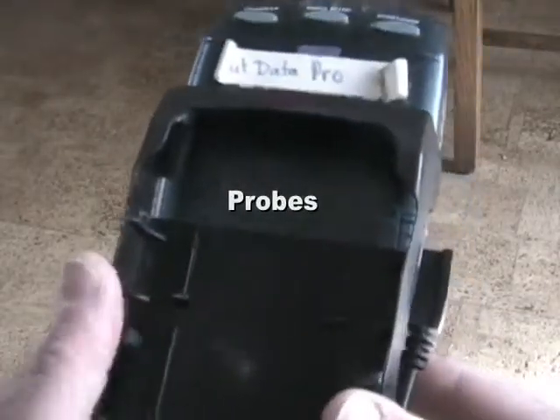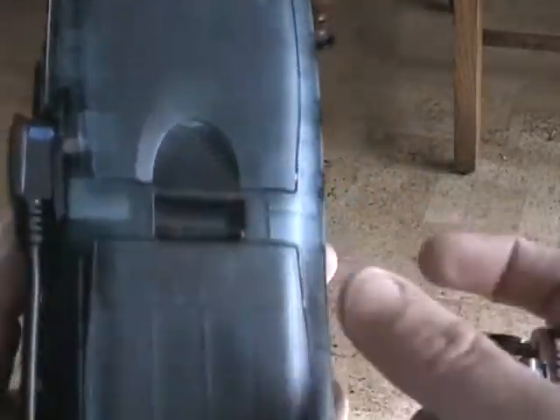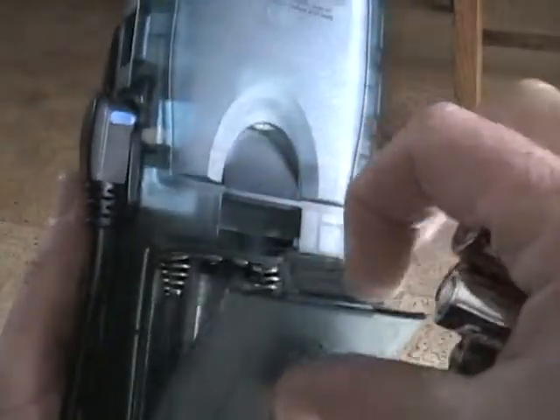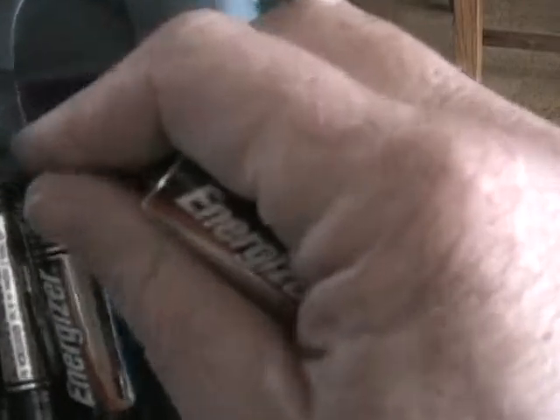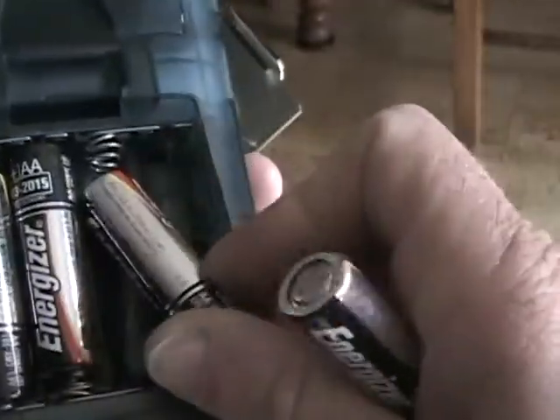This is the Data Pro, which we use for water quality. The first thing you'll need to do in the morning is insert the batteries in the back. We have to take the batteries out every day because these machines just consume batteries like nobody's business. So you put the 4 batteries in the back.